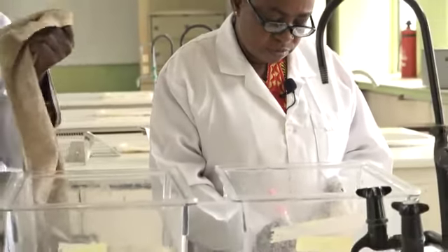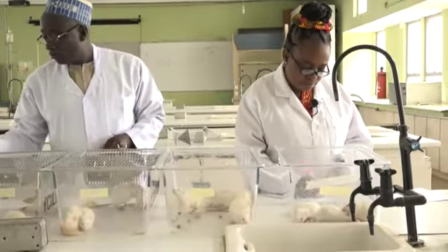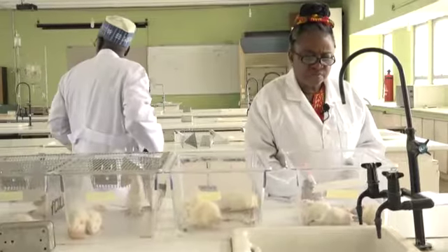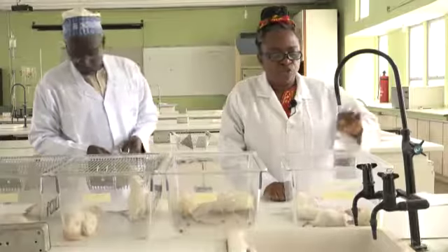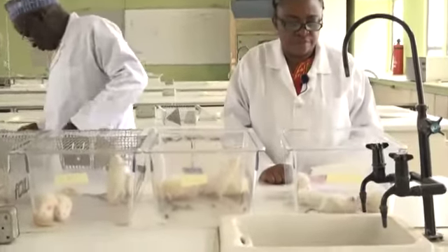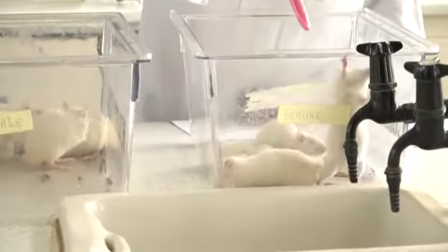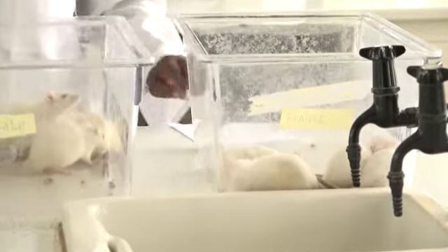Rat number 1 has died. It exhibited signs of toxicity within 3 minutes and died within 5 minutes. Now look at this rat here at the corner. It's also exhibiting signs of toxicity. Similarly, this one, although not as much. Again, this one is still exploring. Biological variation, like I explained to you.